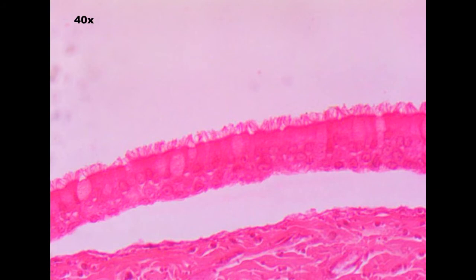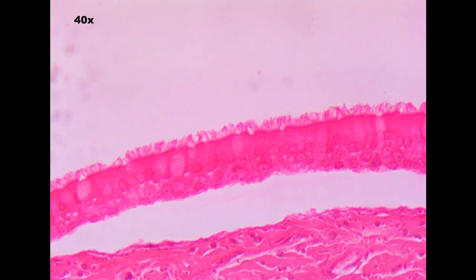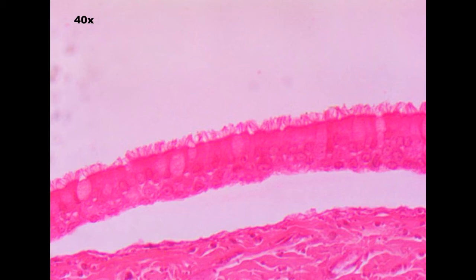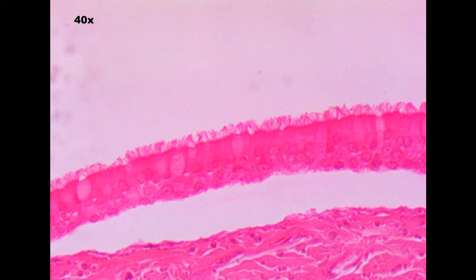Here's our first tissue. Going by the key: does the tissue have cilia? If it doesn't, we go to step two — is it a single sheet of cells? No. We just follow our steps down until we find out which one we think that is. This image is at the 40x objective. Some professors will test you at 40x, some will test you at a 10x objective.